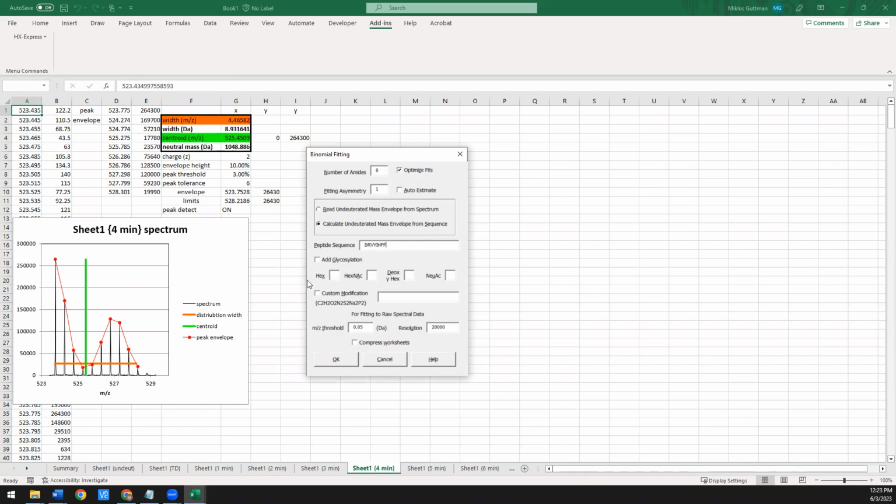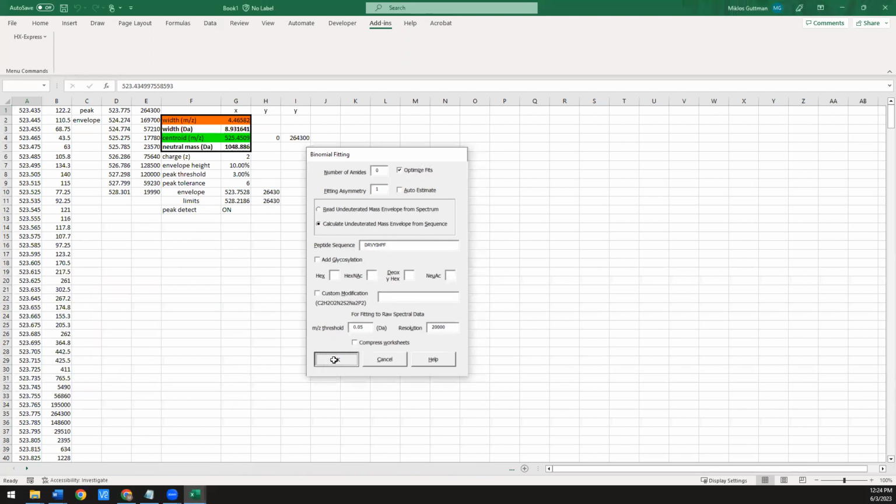If you want to add glycosylation to process a glycopeptide, that's all down here. If you have other modifications, say it was oxidized, you can put in an O there, say add custom modification, and it'll account for that when it calculates the mass. We're not going to do that right now because this is an unmodified peptide. So we're just going to leave that as is and say, okay.